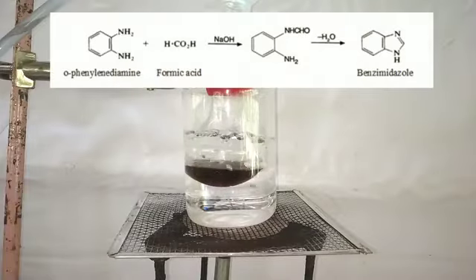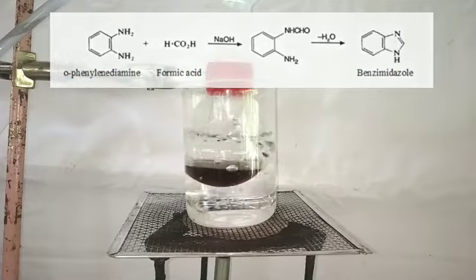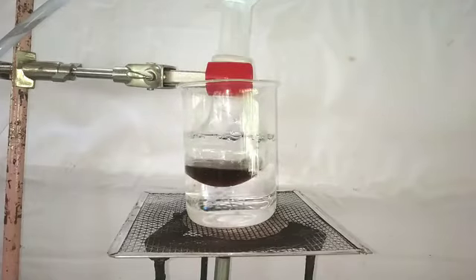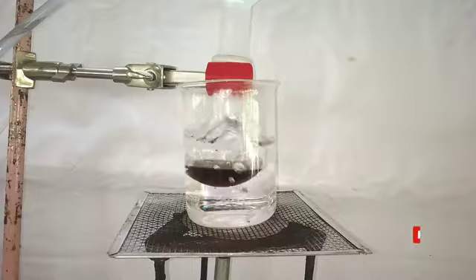What is happening here is shown in the reaction. The formic acid condenses with the amine group of orthophenylene diamine, forming an intermediate with NHCHO side chain. In the next step, there is elimination of a molecule of water, forming the benzimidazole. It is highly soluble in acidic medium, hence it remains in the solution. In the next step, we will be adding an alkali to neutralize the acid, and on neutralization, product will precipitate out.